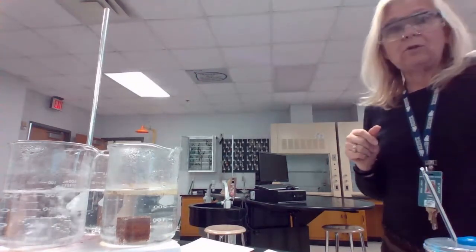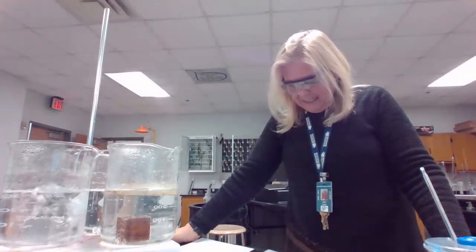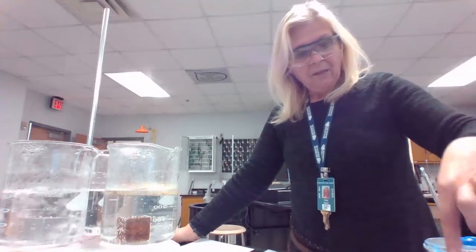We'll get some final temperatures of that. While we are letting those boil, we are going to make a data table. On your own paper, or on a separate Google document, or maybe at the end of this document, it is your choice, you are going to make a data table that will hold all of the information. So far, you have the information about the masses. The aluminum was 47.15 grams, the brass was 138.79 grams, and the copper was 145.71 grams.